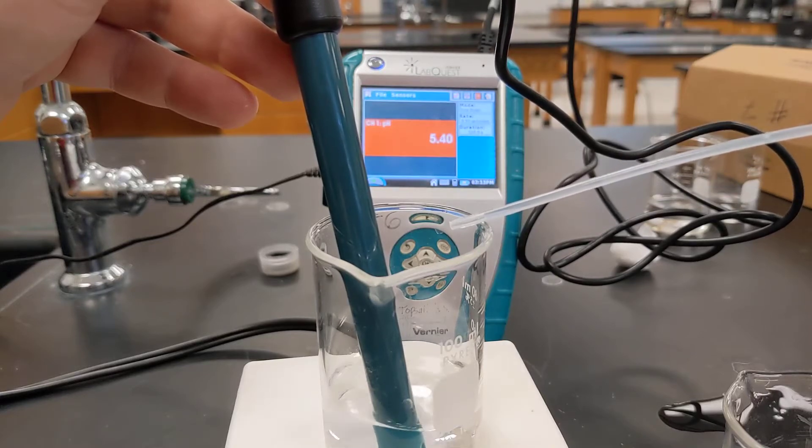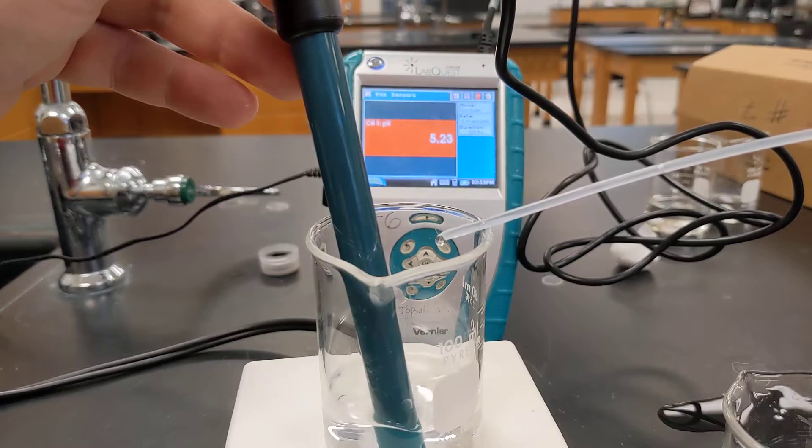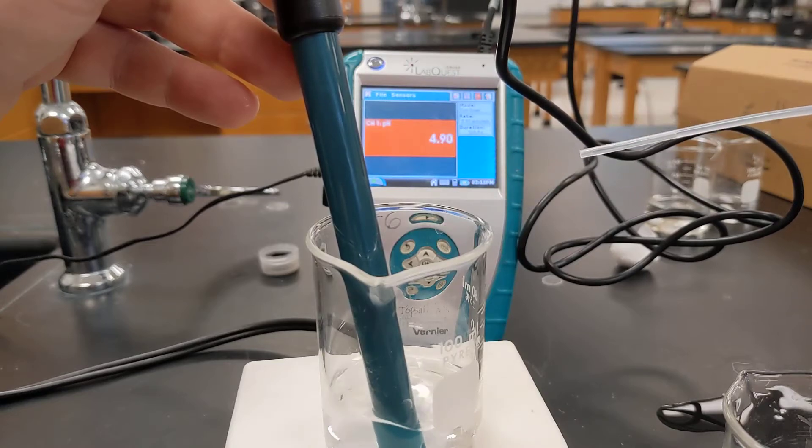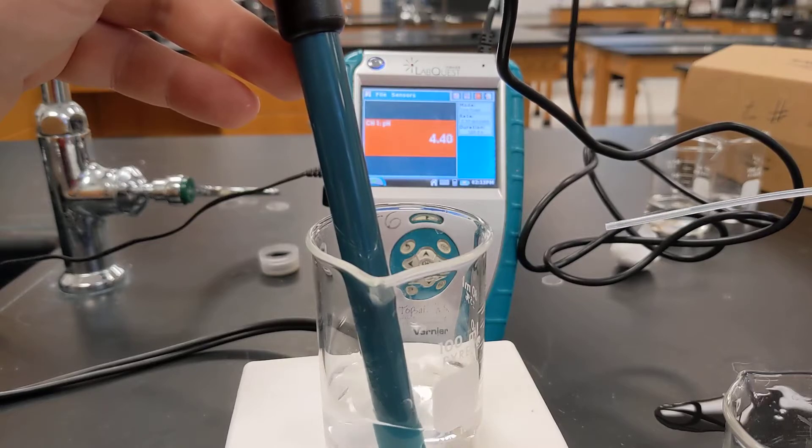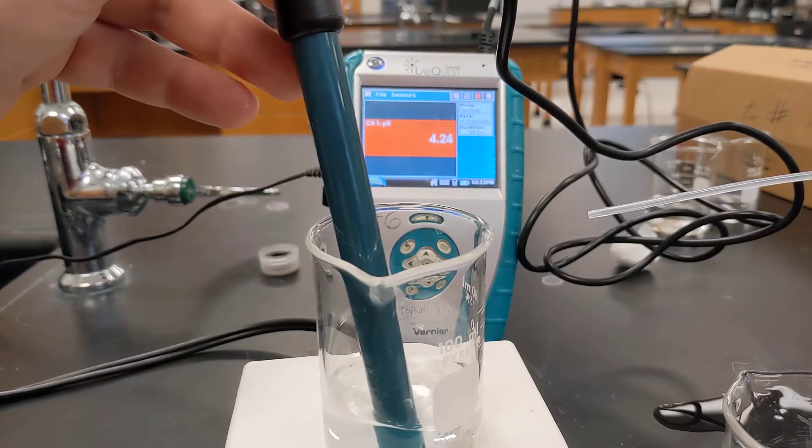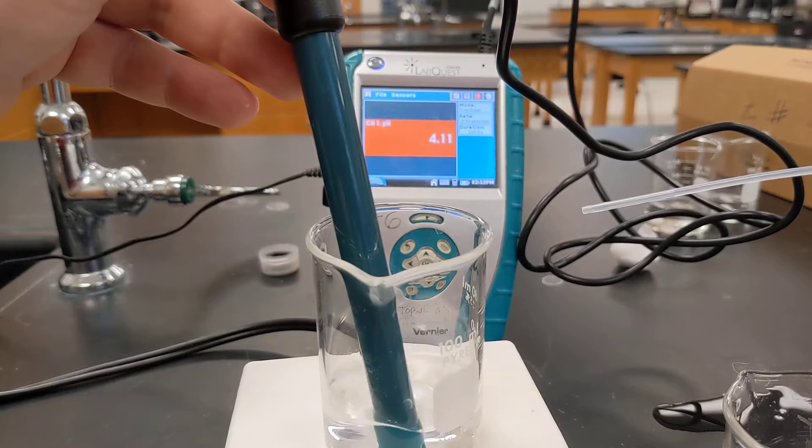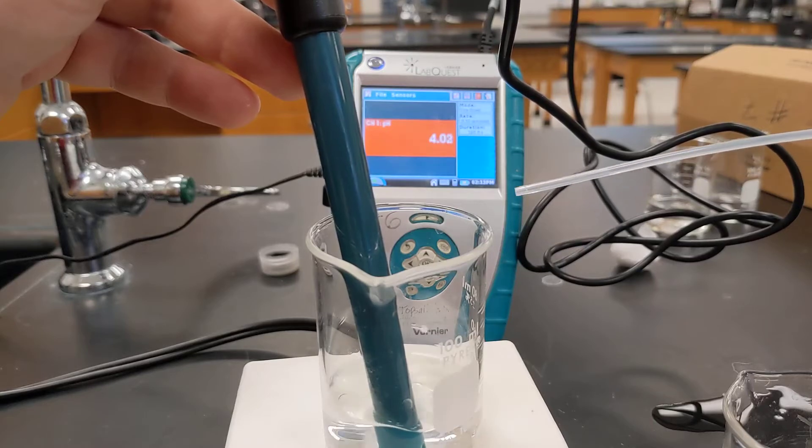And if I add a third drop that sends the pH down yet another whole unit. Keep in mind one unit change in pH is changing the amount of H+ in solution by a factor of 10.